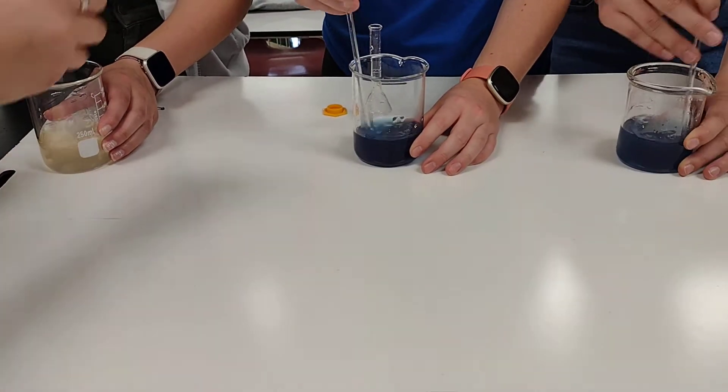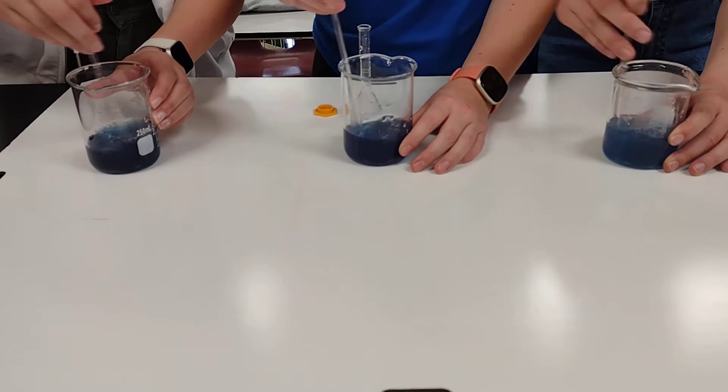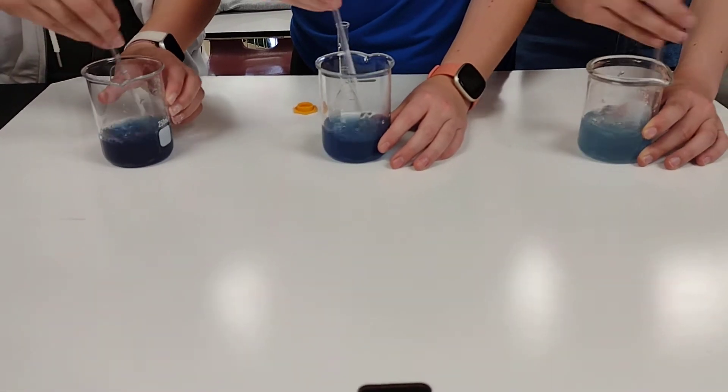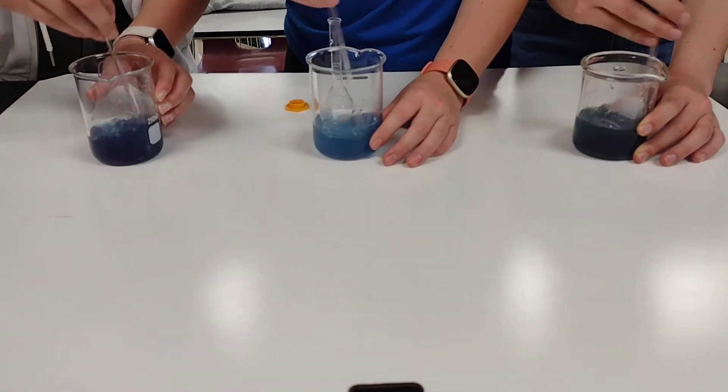Guys, we did it! Goodness, stir fast. We're so smart. Oh, now you have to get it back to the other color too.